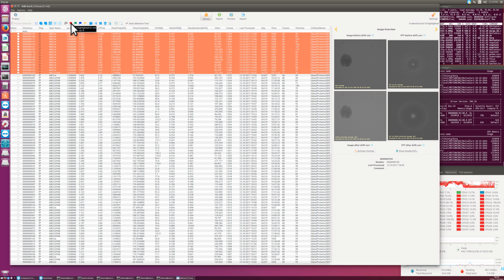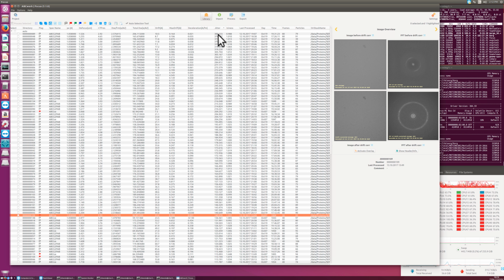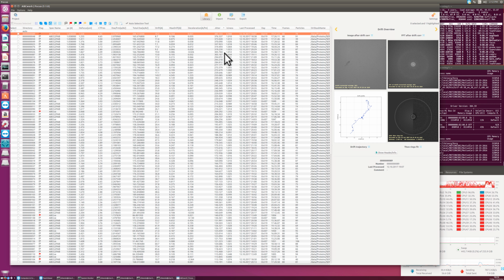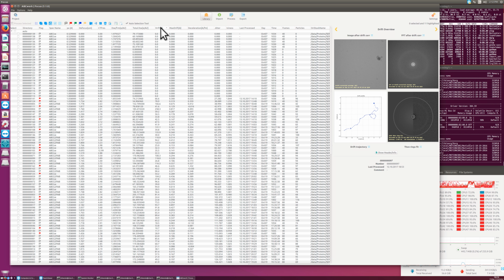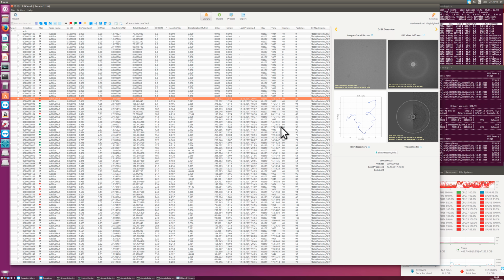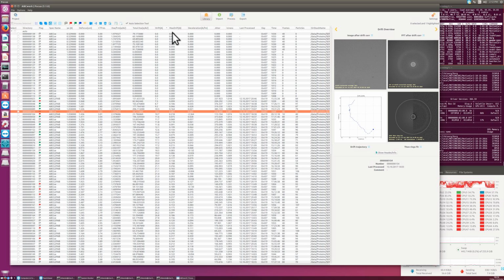I can also flag them, for example, red, and say these are the icy images, and leave them here for the moment. We could sort it by jitter and look for the ones that have too much jitter. So typically everything that has extreme parameters, if you have automatic data collection and enough data, you would just sort these here and say this is too much jitter. The ones that have no drift, for example, total drift. So these here, if the total drift is very small, odds are it just didn't find anything to process, but these drift profiles still look okay. The ones here with 0 have not yet processed.